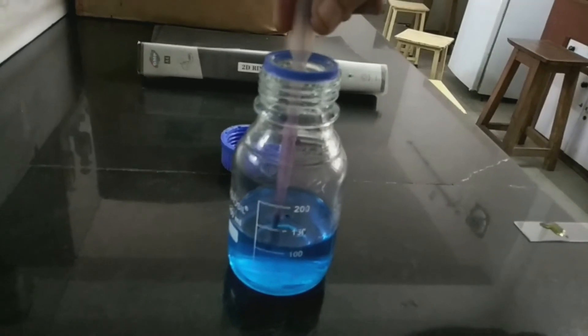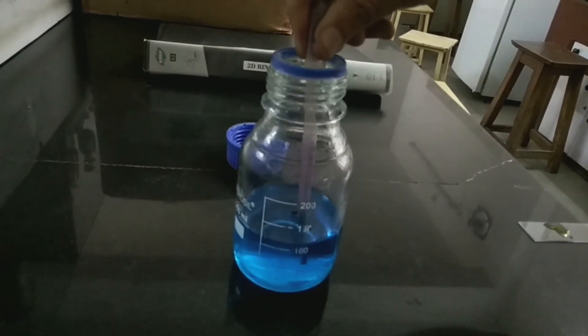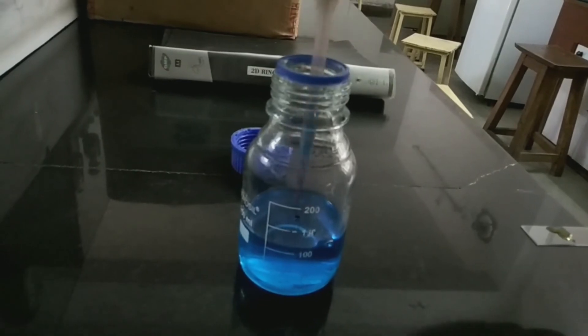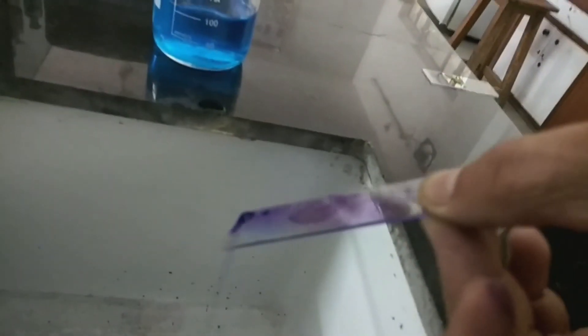Don't use tap water or distilled water here - use only the copper sulfate for washing the smear, because due to tap water or distilled water, the capsule will rinse out. Now wash the smear properly with the 20% copper sulfate.